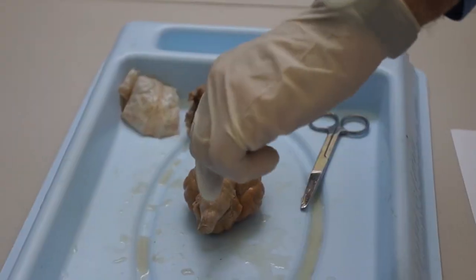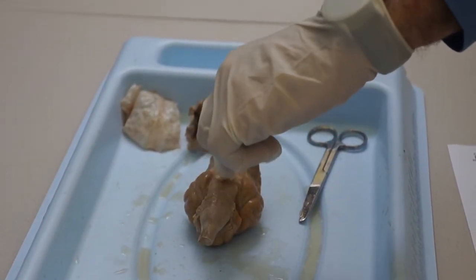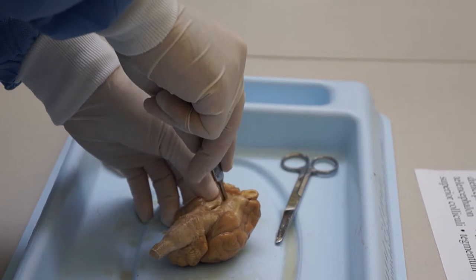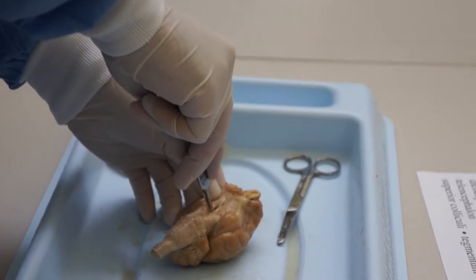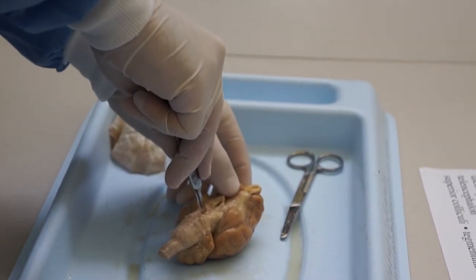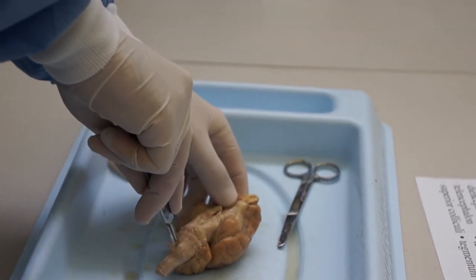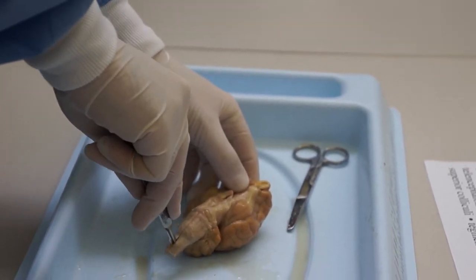What is the name of the line? You want to cut right down the middle here, particularly here. See if you can do it as exact as you can down the midline, because if you get a good cut, you'll actually be able to see the central canal in the brainstem. You'll see its connection all the way down.